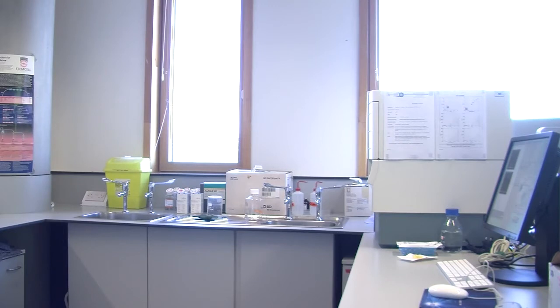Yes. You could do multiple assays, because you often want to validate your assay. But what you'd then do, if clumping was a potential issue, is bring in microscopy, because microscopy may well only look at some cells. If you look down the microscope, you see clump, individual cell. You think, right, I've got a problem.